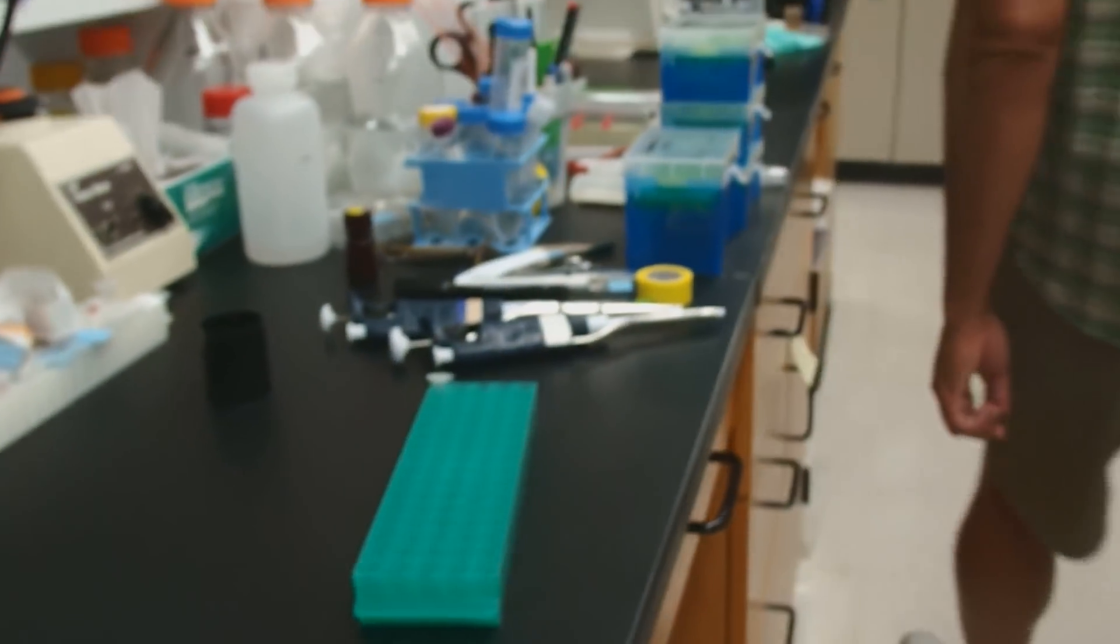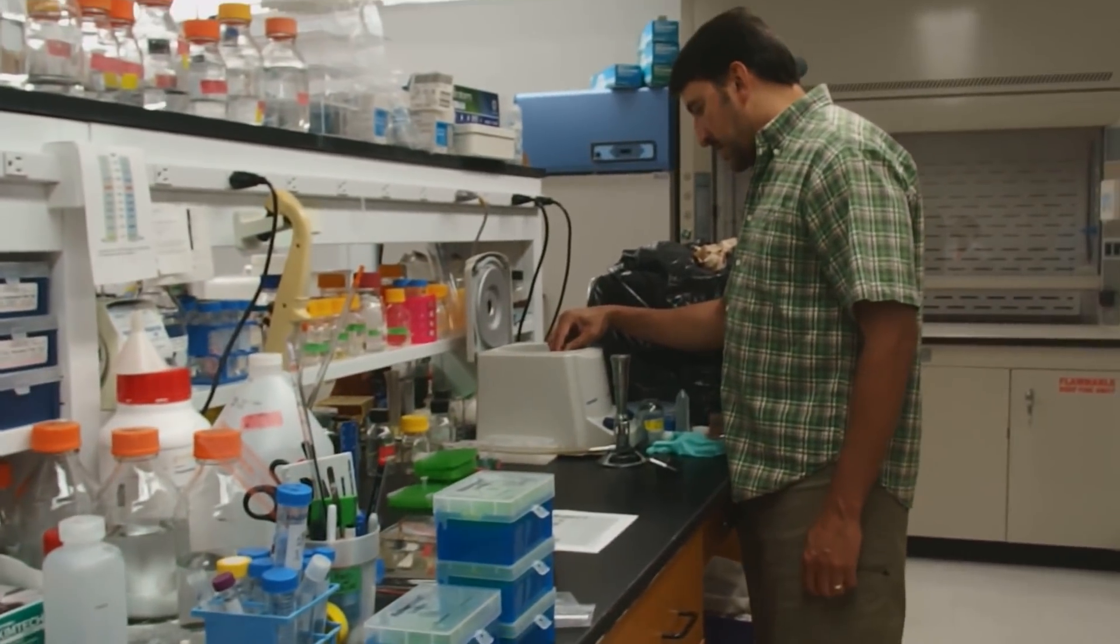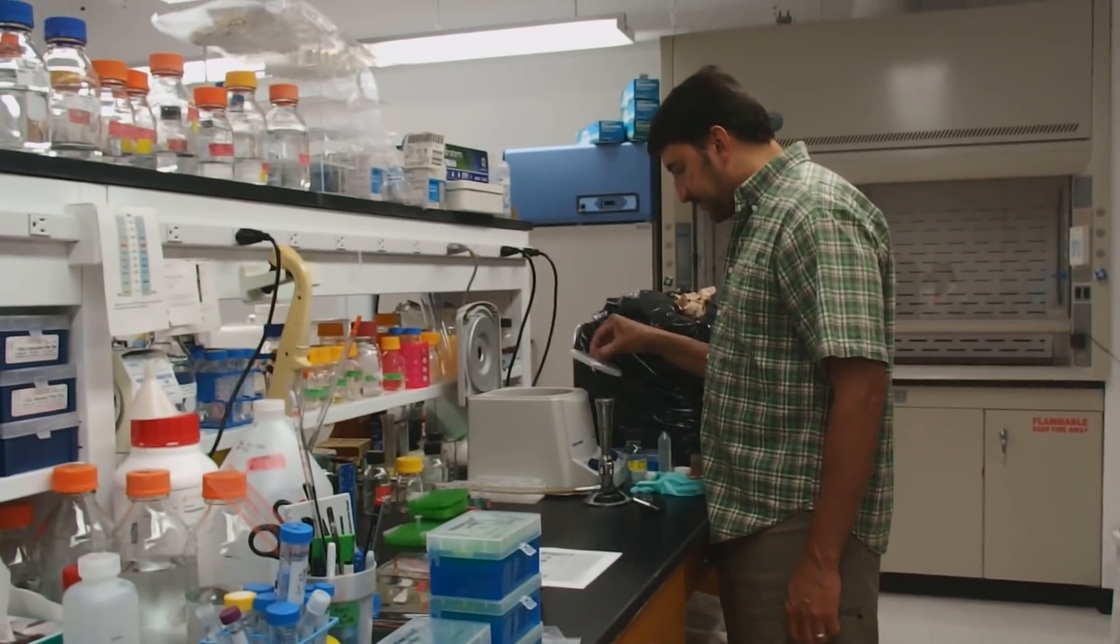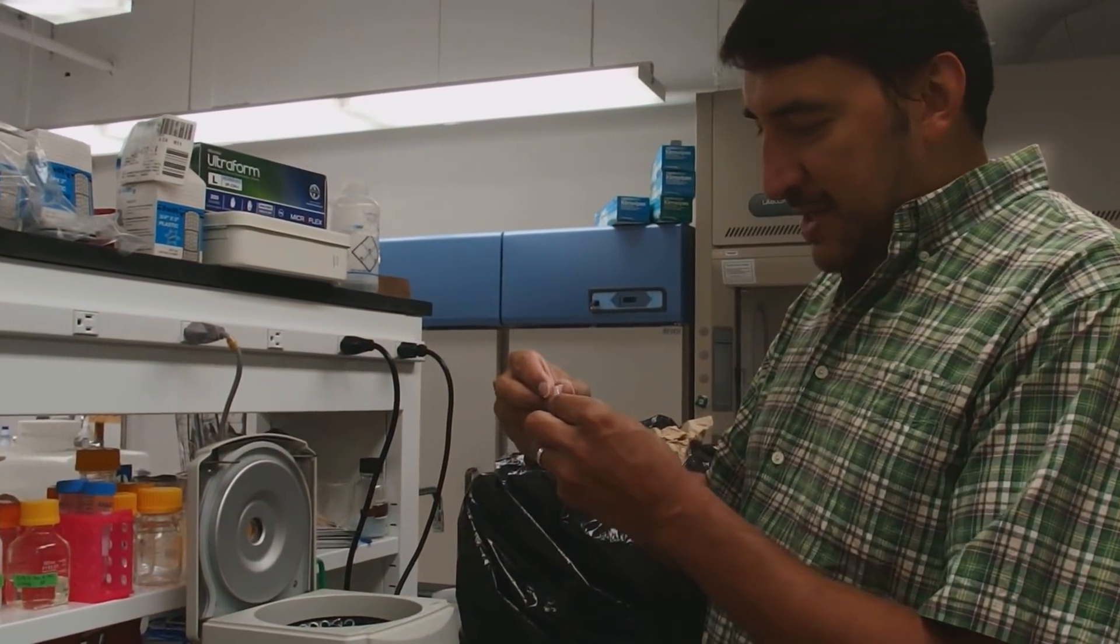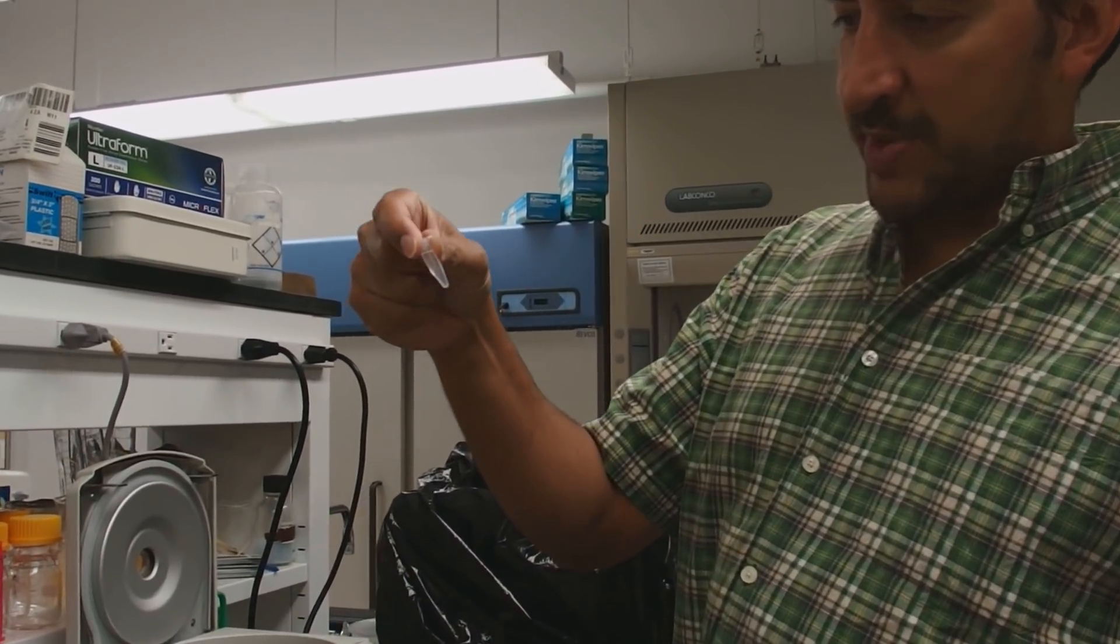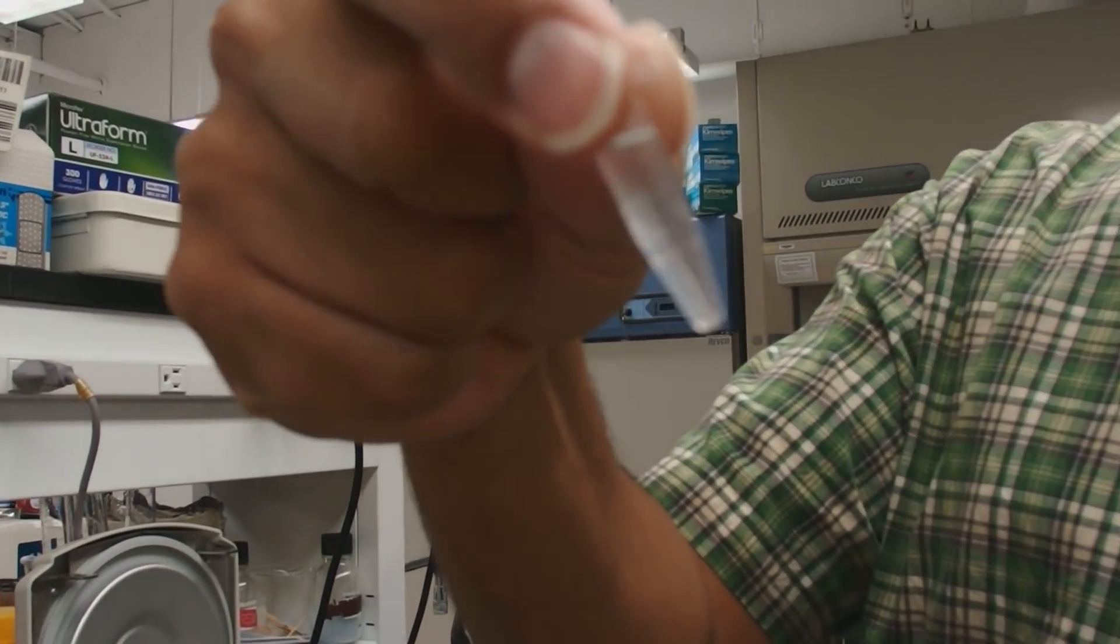So we're going to just give this a brief spin. 30 seconds. My quick spin is done just to make sure the pellet is, you know, toward the bottom of the tube and attached again. So you can see there.